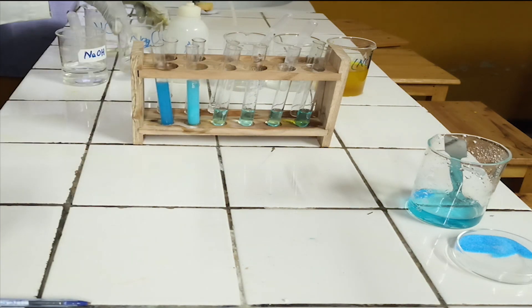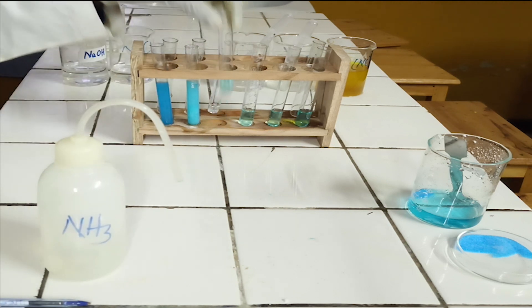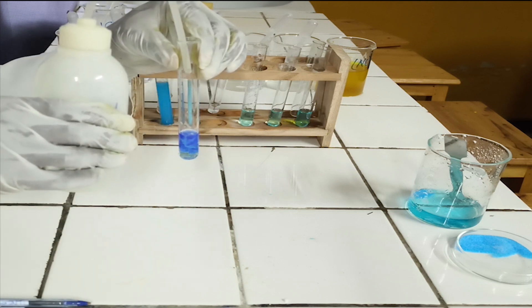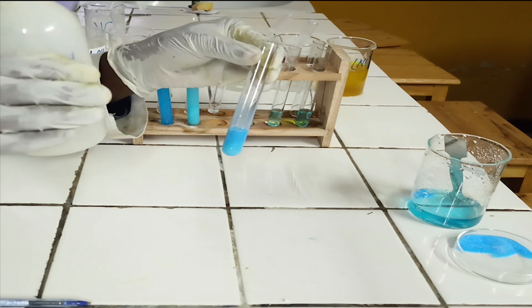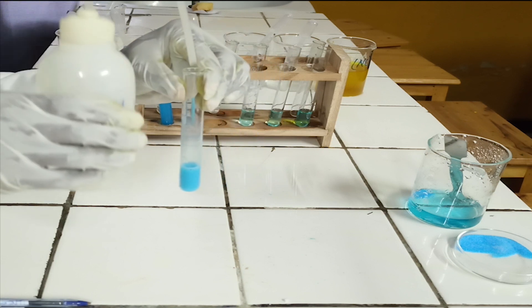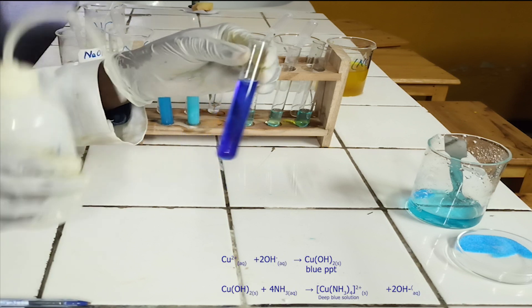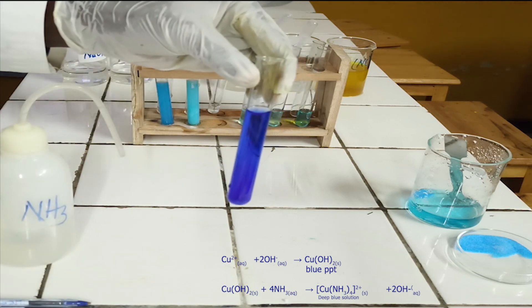Confirmatory tests. To the third test tube, add ammonia solution dropwise until in excess. As you see, ammonia reacts with copper-2-ion to form a blue precipitate, which is soluble in excess of ammonia to form a deep blue solution. Below, there is the ionic equation for this reaction.